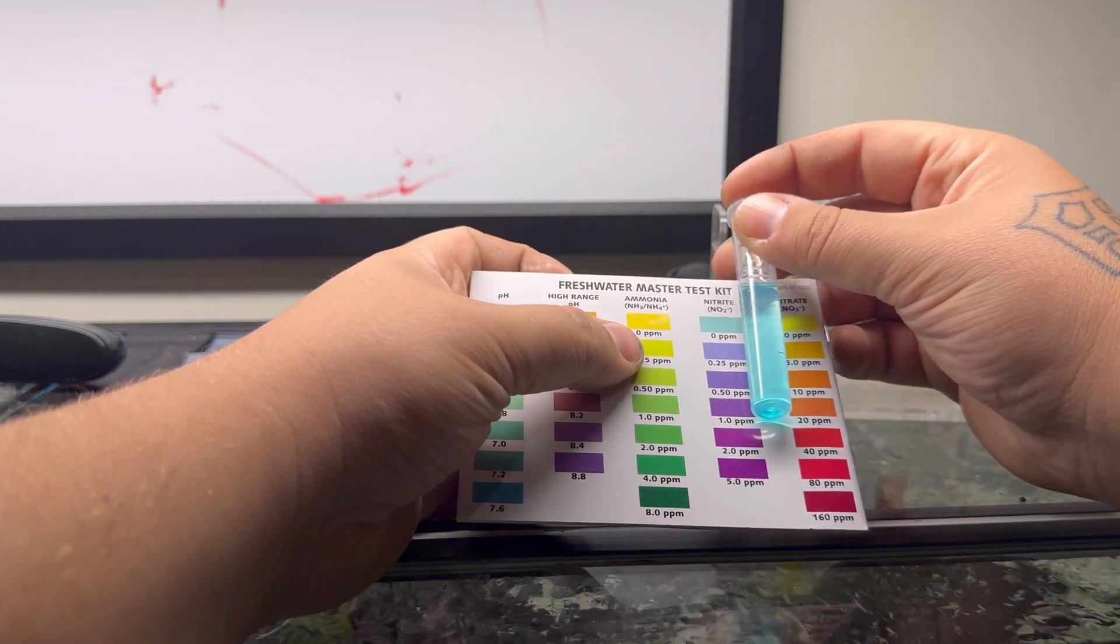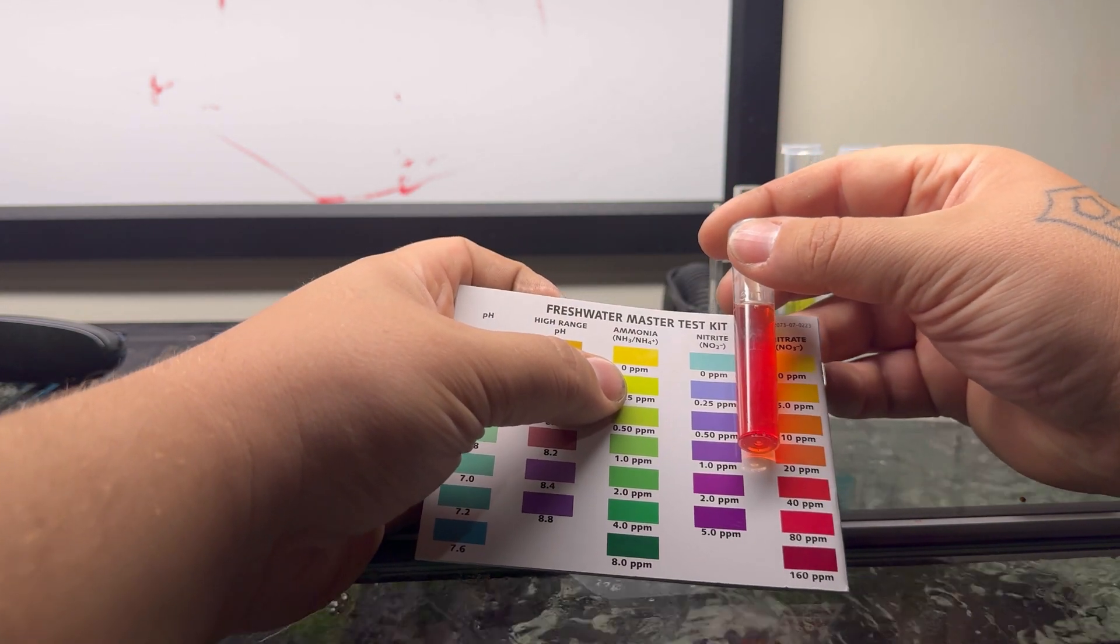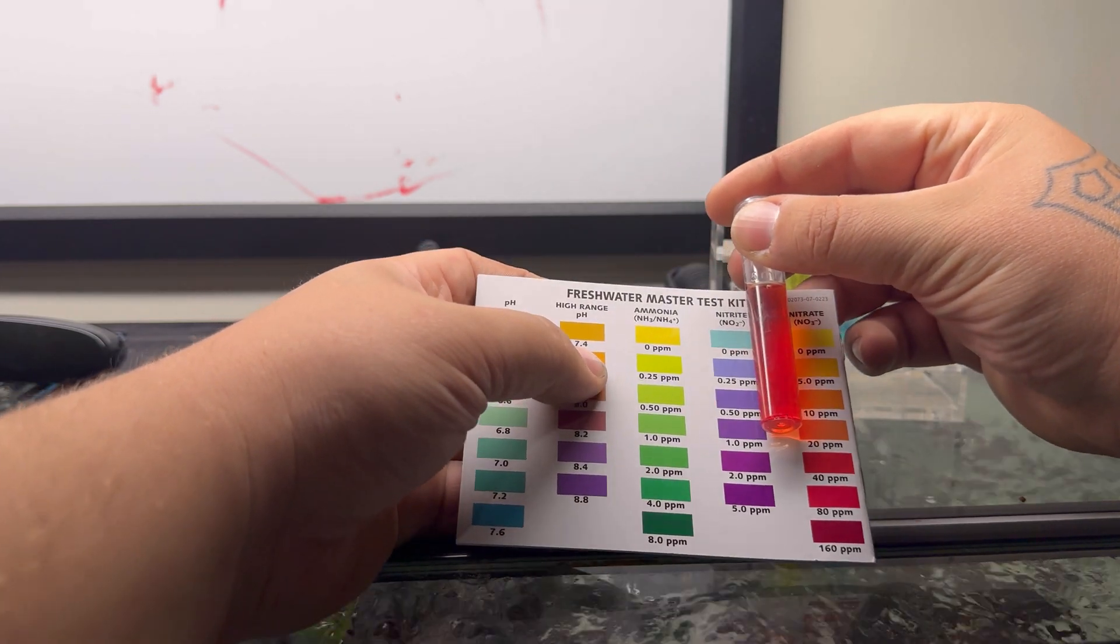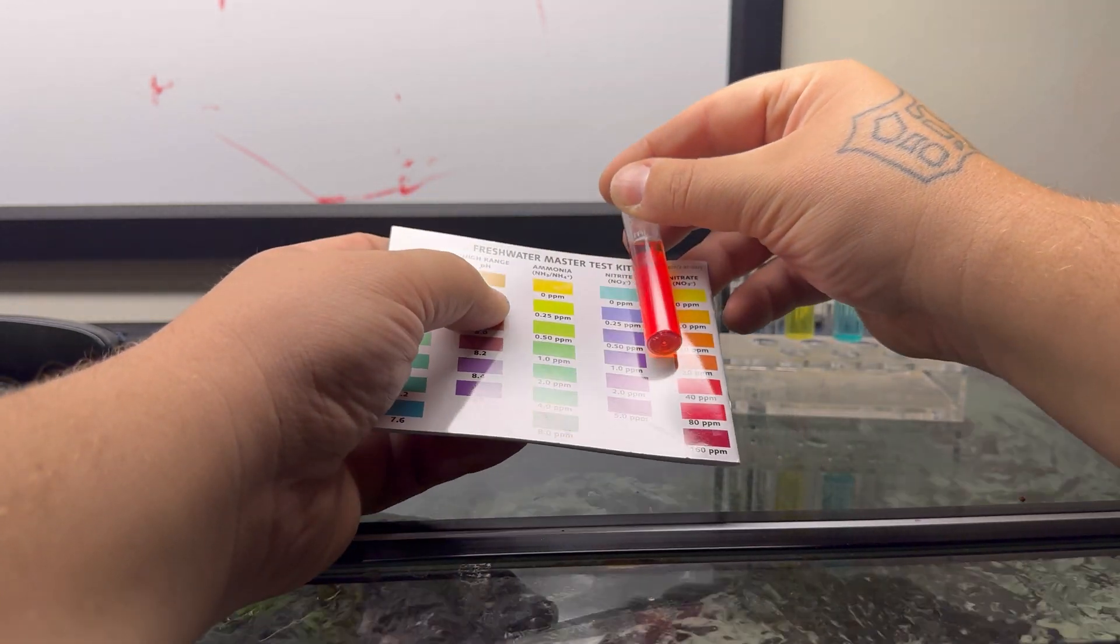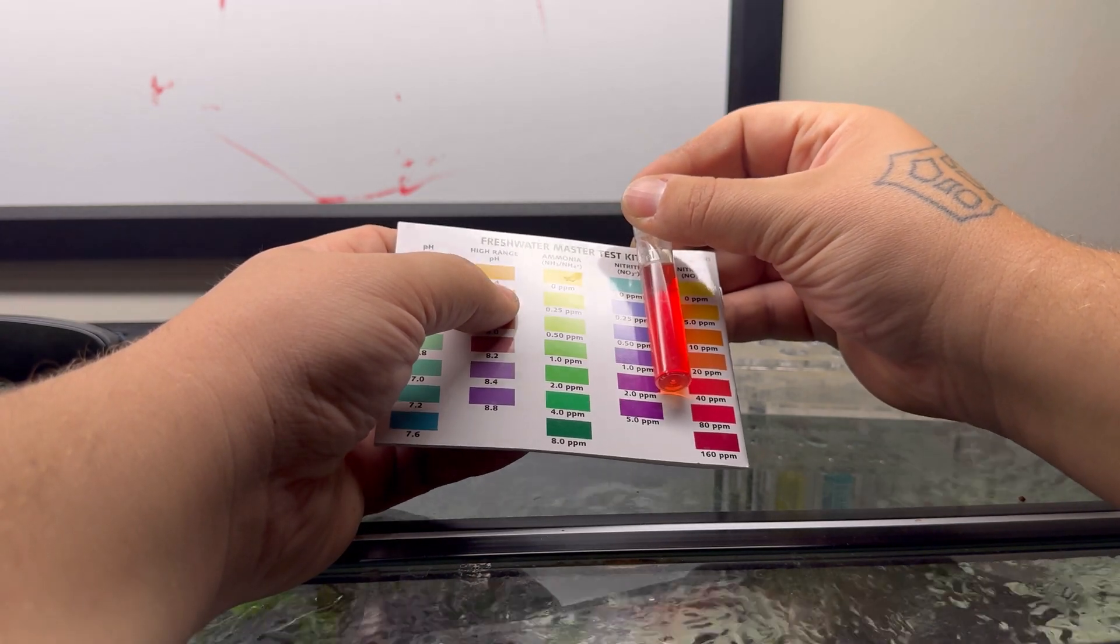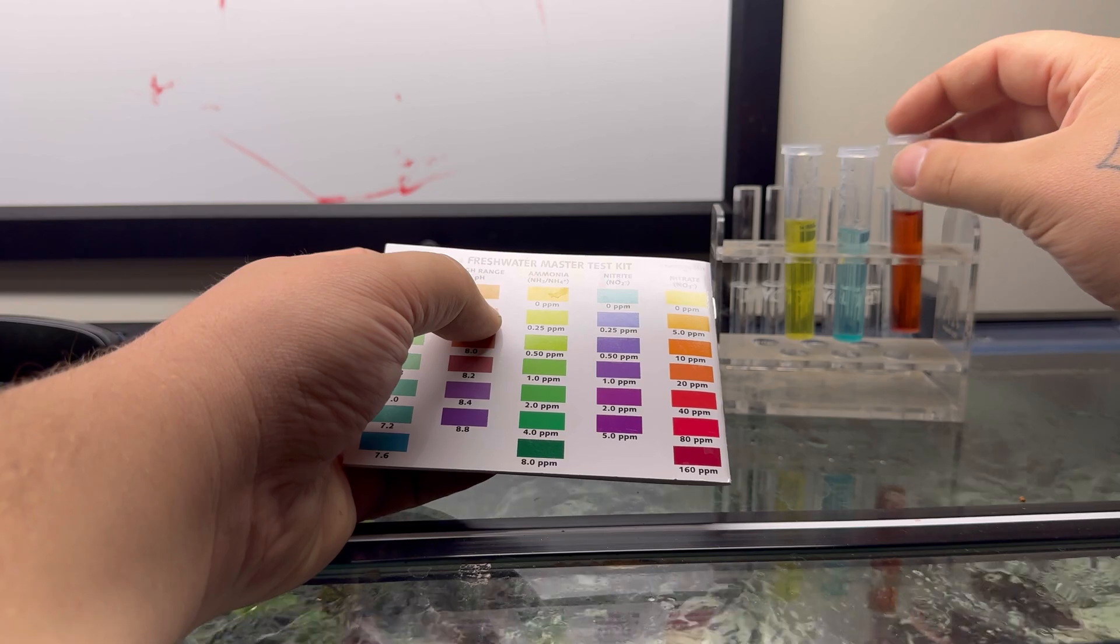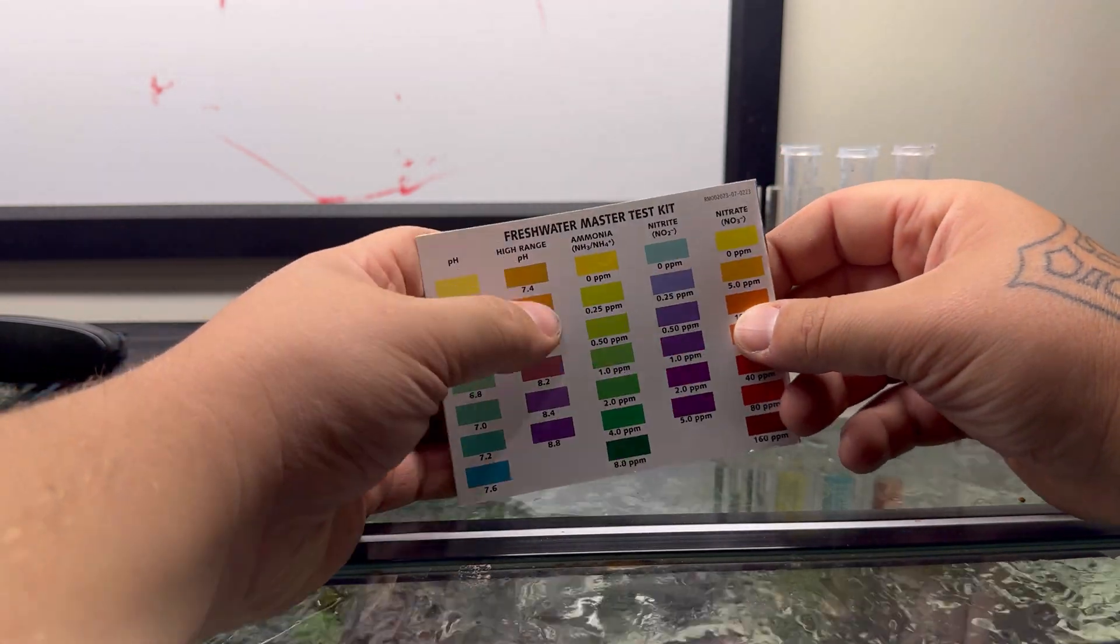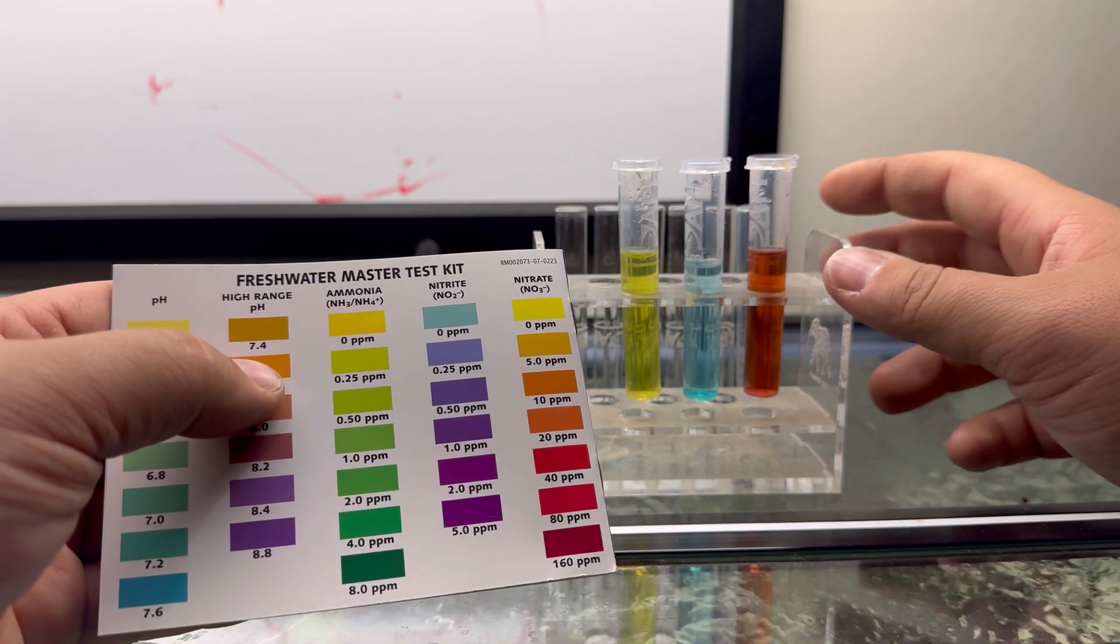I'm going to look at this and compare it and look at the closest color matching to it. If it's kind of in between, then it's in between. For instance, if I think it's in between zero and 0.25, it's going to be 0.12 or whatever. Moving on—nitrite, same thing. We're going to put it down here, color code it, and figure out exactly where it's at.